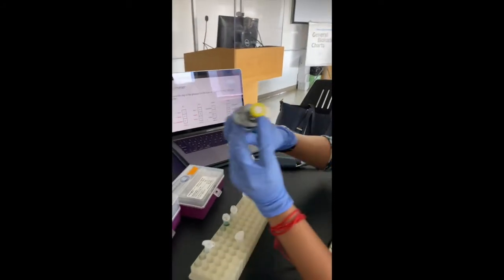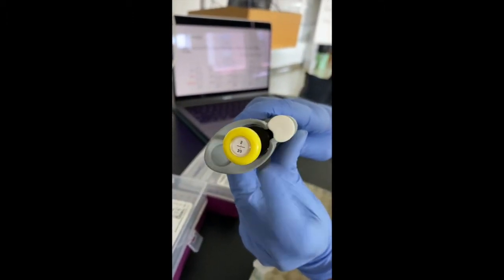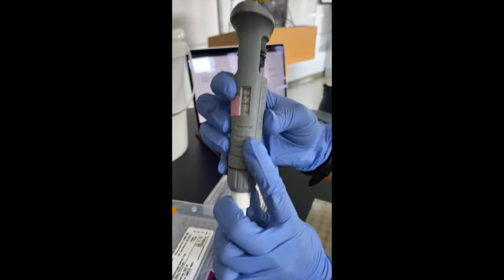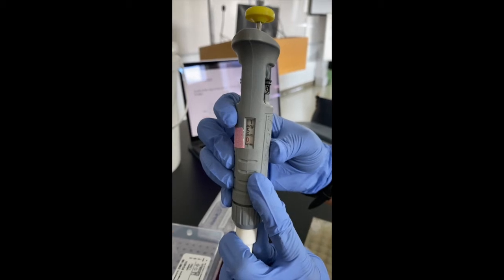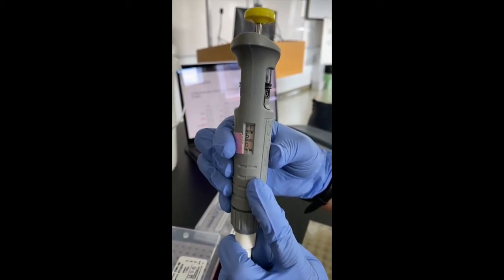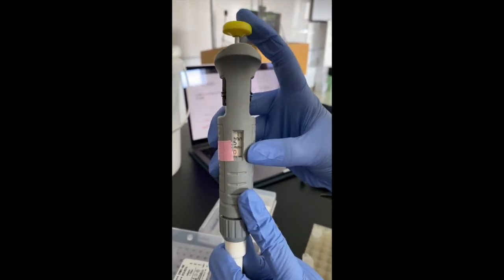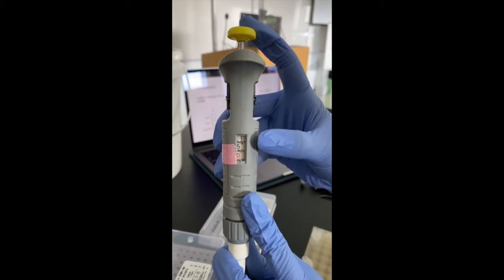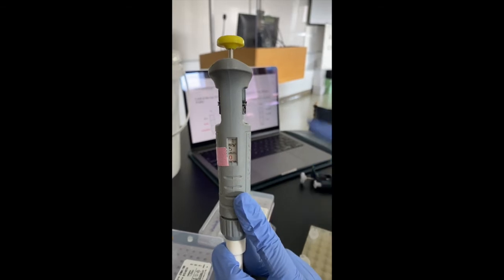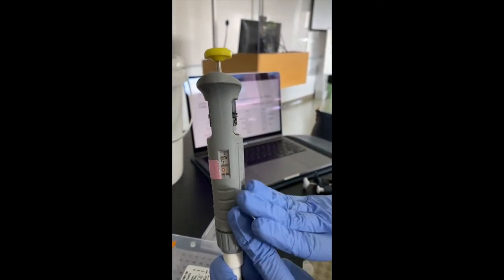The next pipette that we have is P20. The smallest volume it can measure is 2 microliters, and the largest volume it can measure is 20 microliters. This is the volume indicator window, and for P20, the first digit is the tens digit, the second digit is the ones digit, and the final digit is the first digit after the decimal point. So 150 on a P20 would indicate a volume of 15.0 microliters, and just as with P2, you can use the volume adjustment threads to change the volume that you want and set a specific volume.